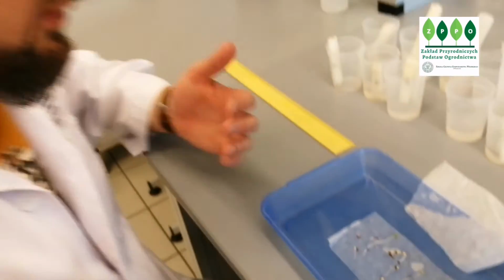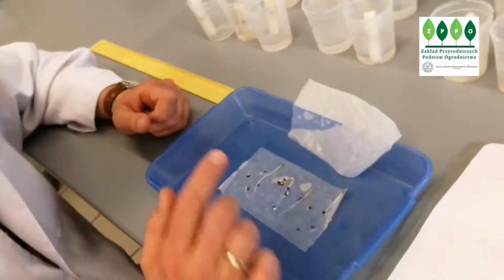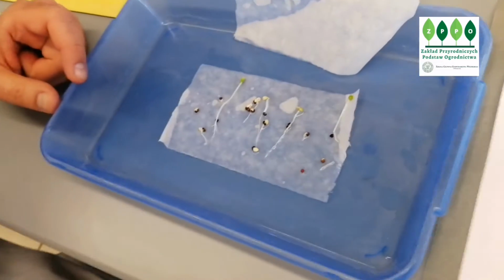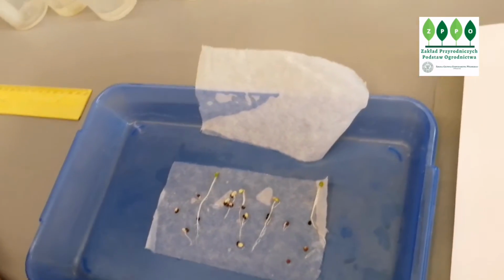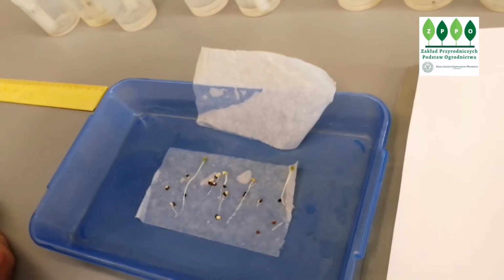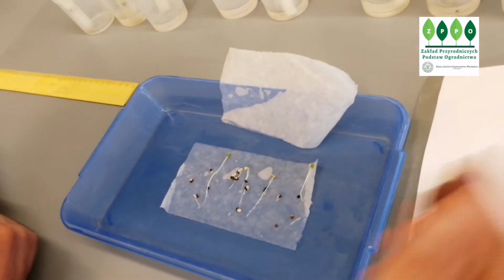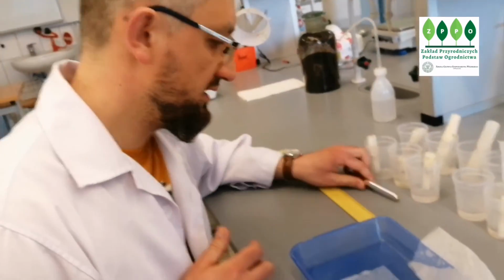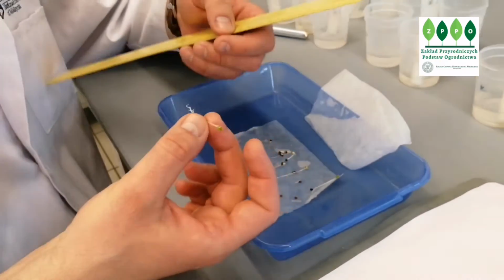The first thing we do is to calculate the number of germinated seeds. So I have to count them. Here one is not germinated. So if total was 10, the germinated was 9, that's salt, control, so 9 germinated. And then I will have to measure a root.